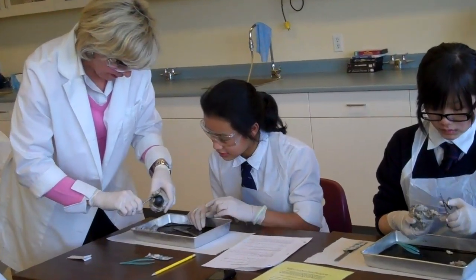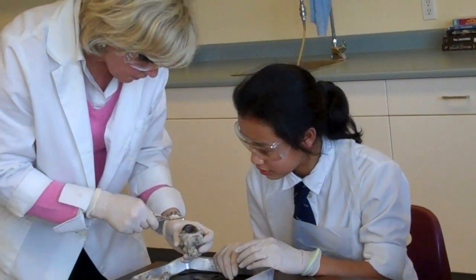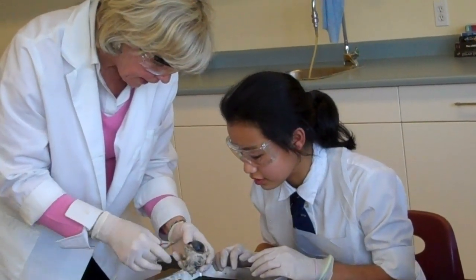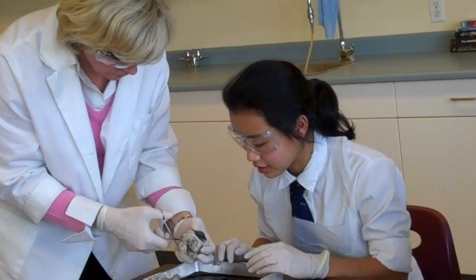What do we do now? Isn't that cut off? Do you know what this is? That's the cornea. No, no, no — your pupil is underneath there. Is that okay now to work with?